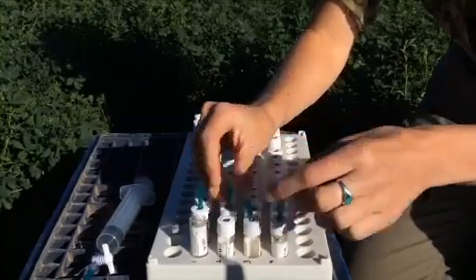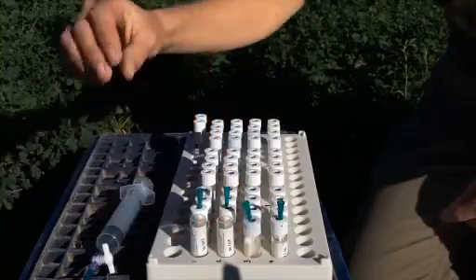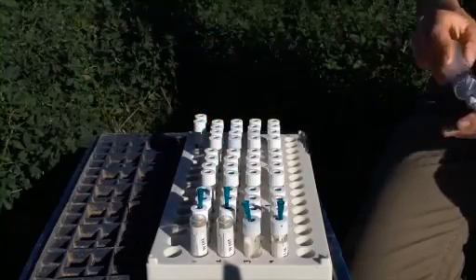Close the stopcock and withdraw the syringe needle from the septum. Insert the extra needle into the next vial to be used and turn the filled vial upside down to distinguish it from unfilled vials.